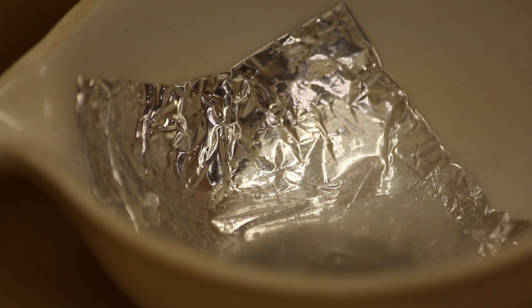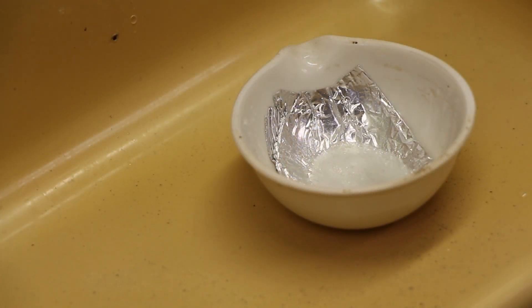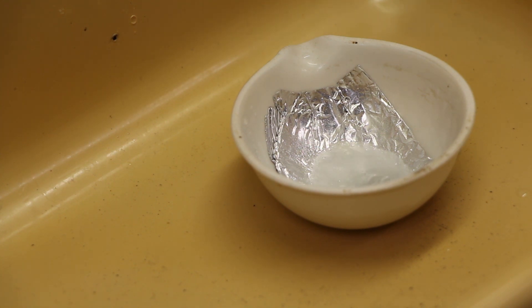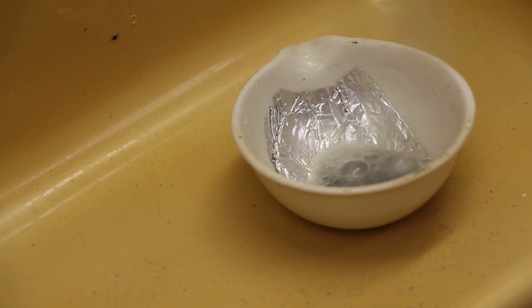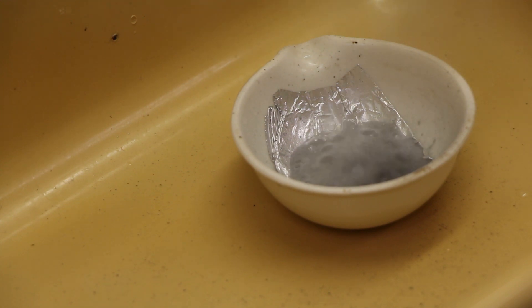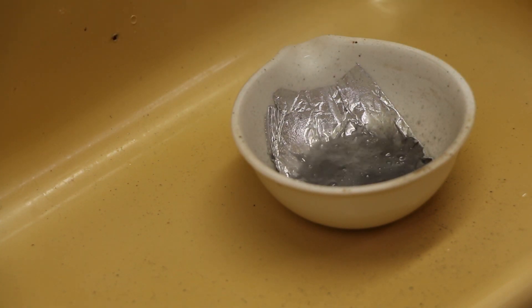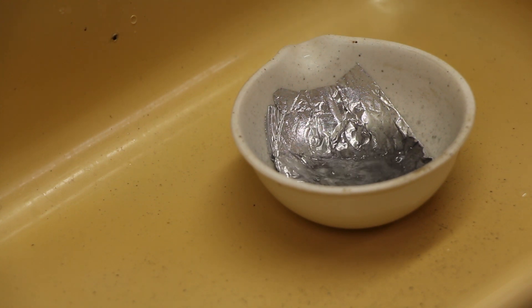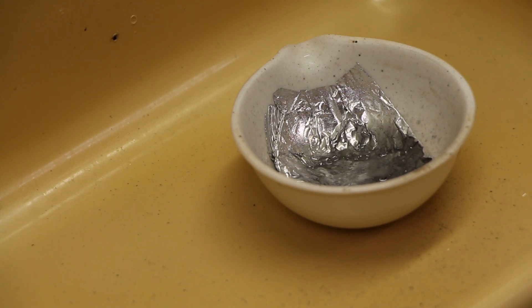Now the water is starting to boil, and it's starting to fizz. So what you're going to look at is how much aluminum goes away — where does the aluminum go? What happened to the aluminum that's missing after this is all set and done? It gets so hot that the liquid boils and leaves the aluminum salt behind.